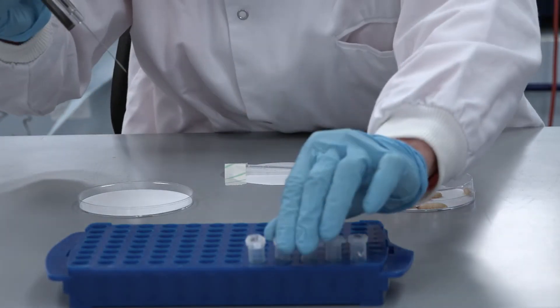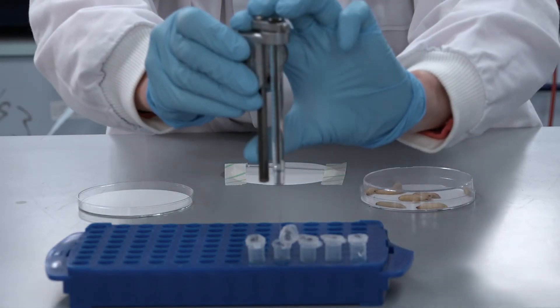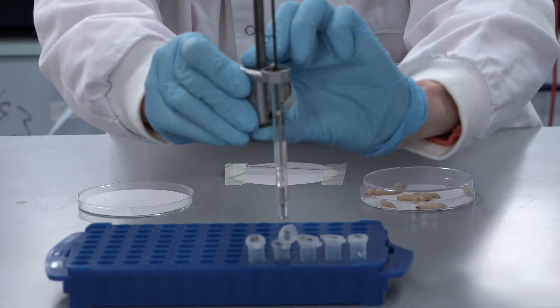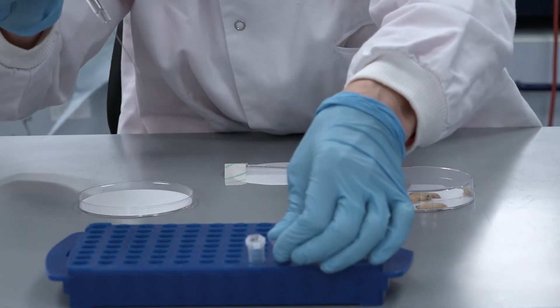Inject 10 larvae with each dose with a volume of 10 microliters, starting with the lowest dilution and working up to the highest dilution.